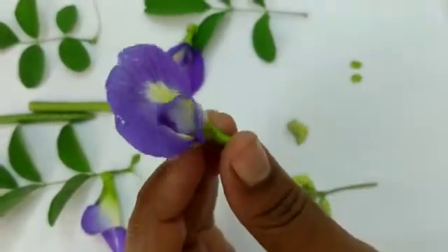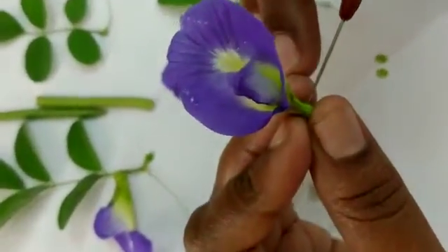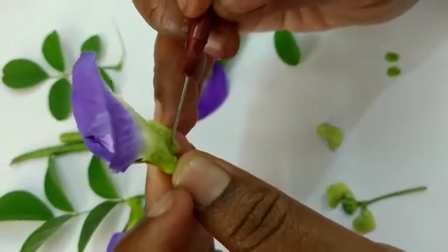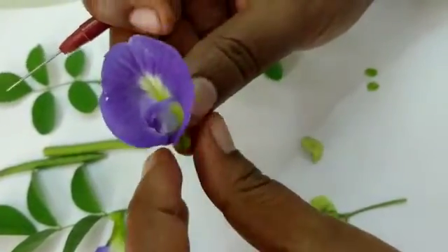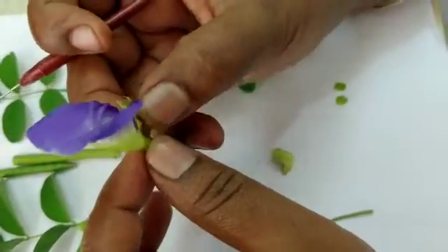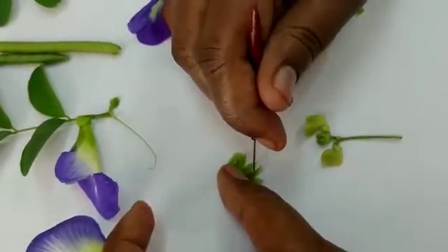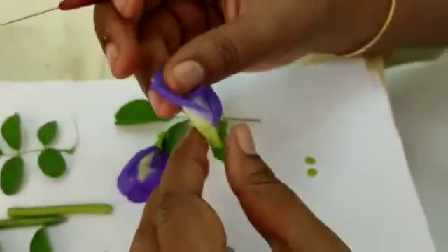Now we will see the calyx. The unit of calyx is the sepal. Five sepals are present. To open the sepal, just tear it with the help of a needle and open it. This is in gamosepalous condition because all the sepals are united. I am inverting it — you can check: one, two, three, four, five. Five sepals are present.